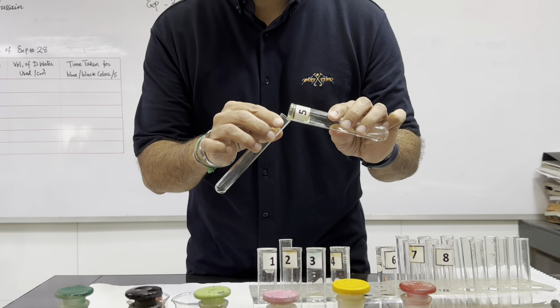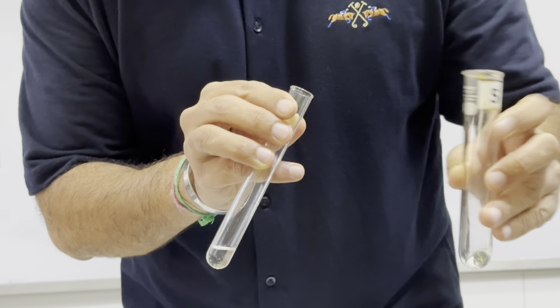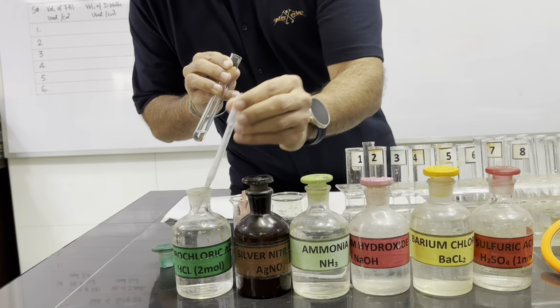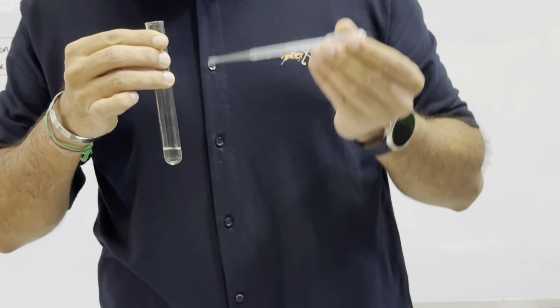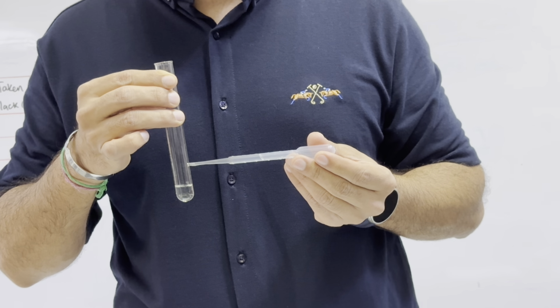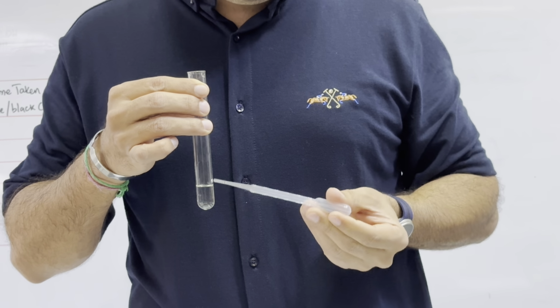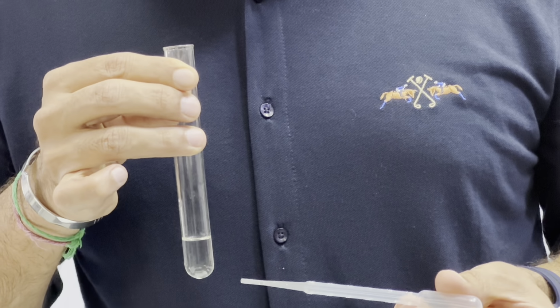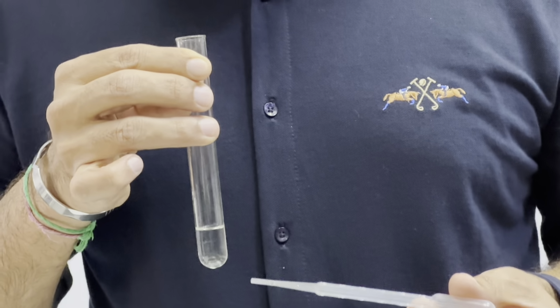So first of all, what we will do is, we will take 1 centimeter depth of Fa5 and we will add acid to observe the gas, if colorless gas is given off or not. So now we will add in this solution equal volume of acid. So this is 1 centimeter depth, and then we will add 1 centimeter more. If I have added 1 centimeter of acid, we can see there is no gas given off. Even on shaking, there is no gas given off, which means that it doesn't have nitrite. It contains nitrate, right?